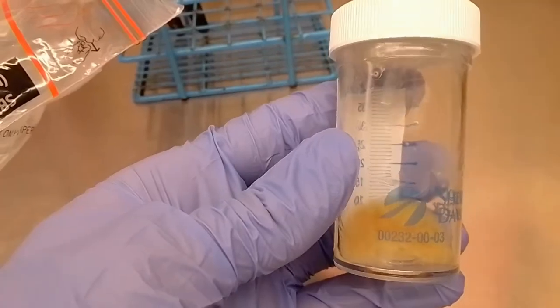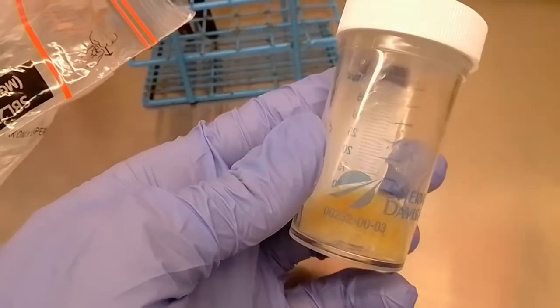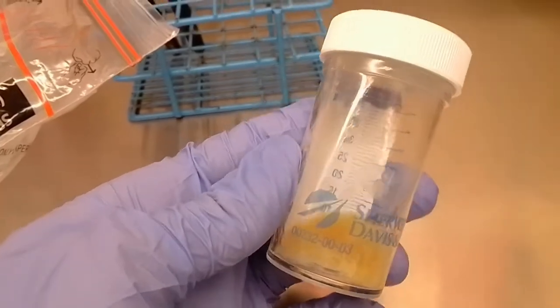Hey everyone, this is Dylan here and today I'm going to go over how to culture. There are three main steps when it comes to culturing. The first one is going to be your specimen or sample — what exactly are you looking for.